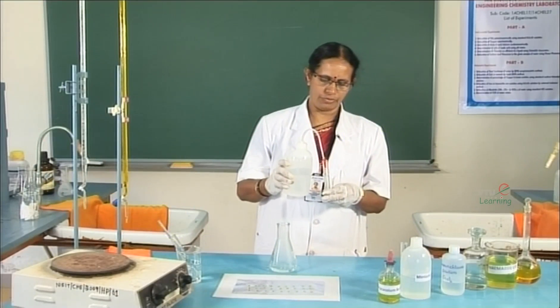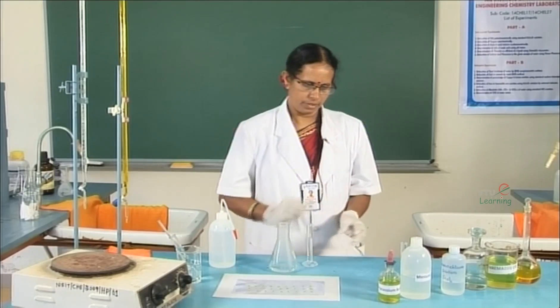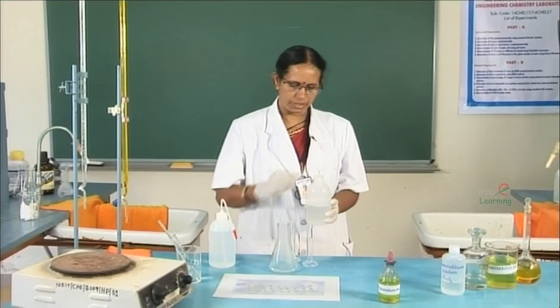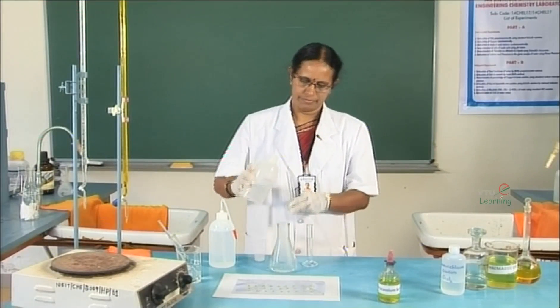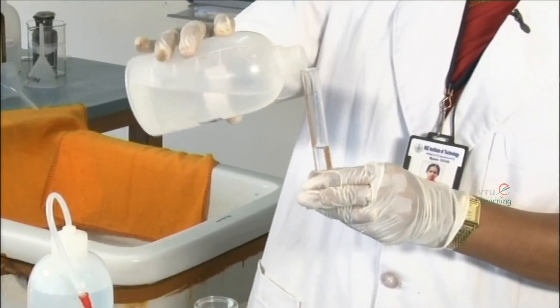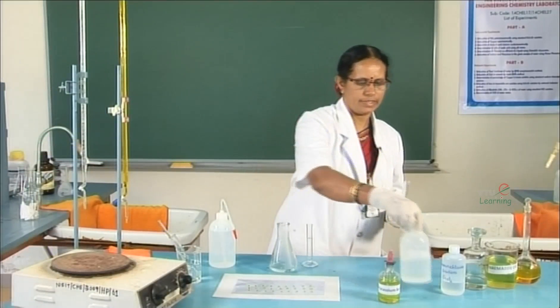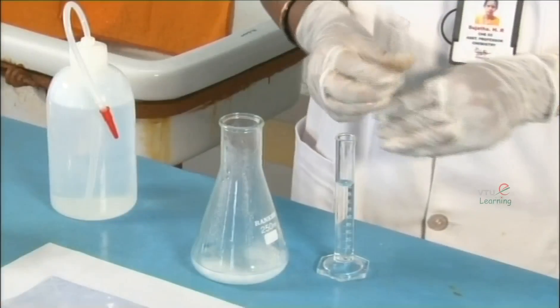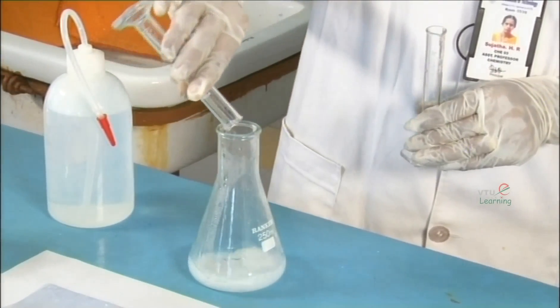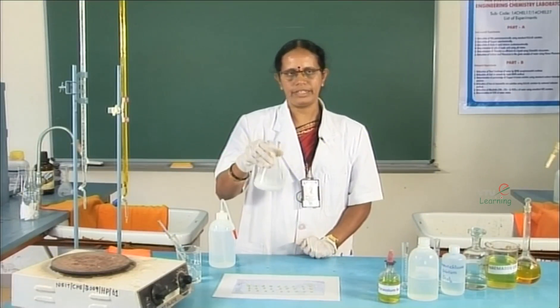Around 10 ml of water and 5 ml of mercury chloride has to be added. Mercury chloride is added to oxidize the excess stannous chloride present in the solution. The formation of a silky white precipitate indicates the complete oxidation of stannous chloride.